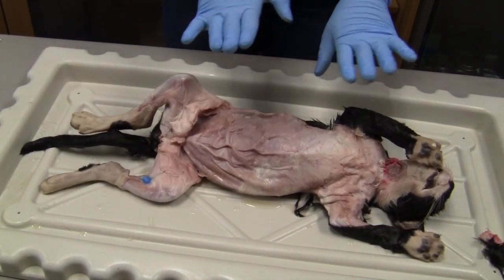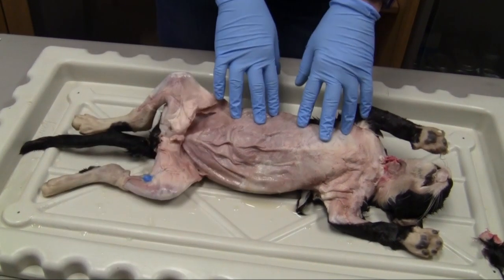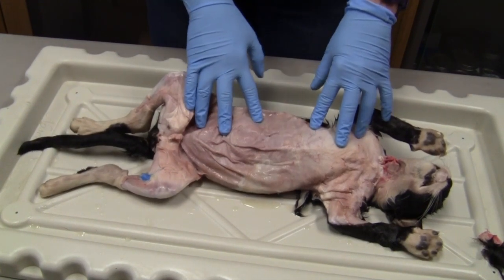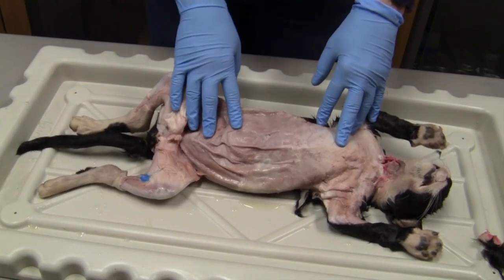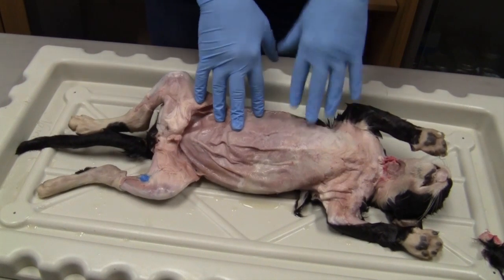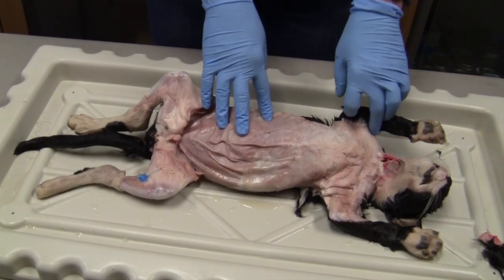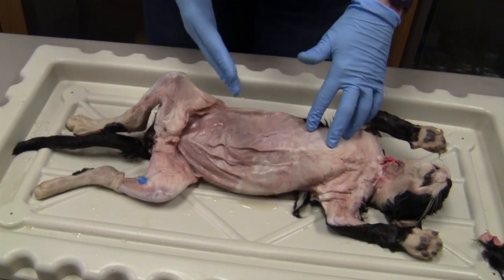Hi everyone! So today we are going to be dissecting your cats, and the biggest difference is my cat clearly has the skin taken off. So I went ahead and took all the skin and all the hair off for the purpose of this video, and you guys are going to have to take some time during lab to get the skin off as well.